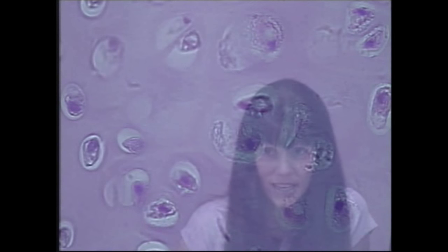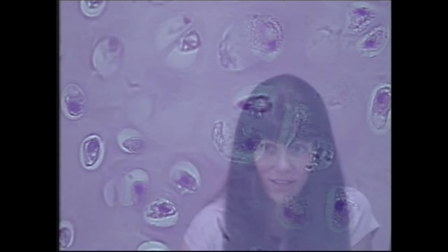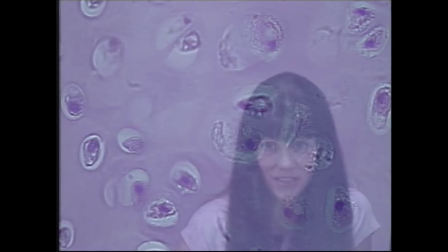Remember, hyaline cartilage is one of the three types of specialized connective tissue — we have blood, bone, and cartilage. Now we're going to look at elastic cartilage next so you can tell the difference between the two.